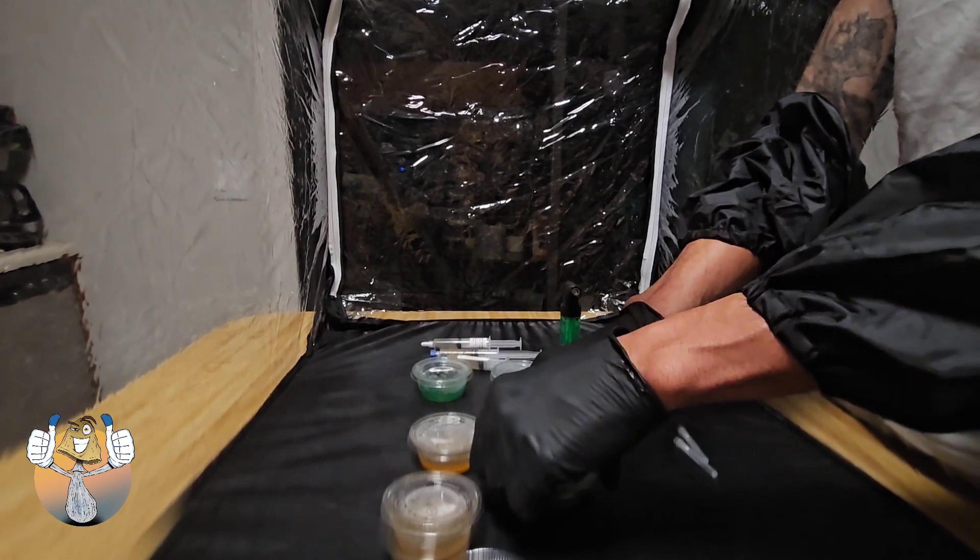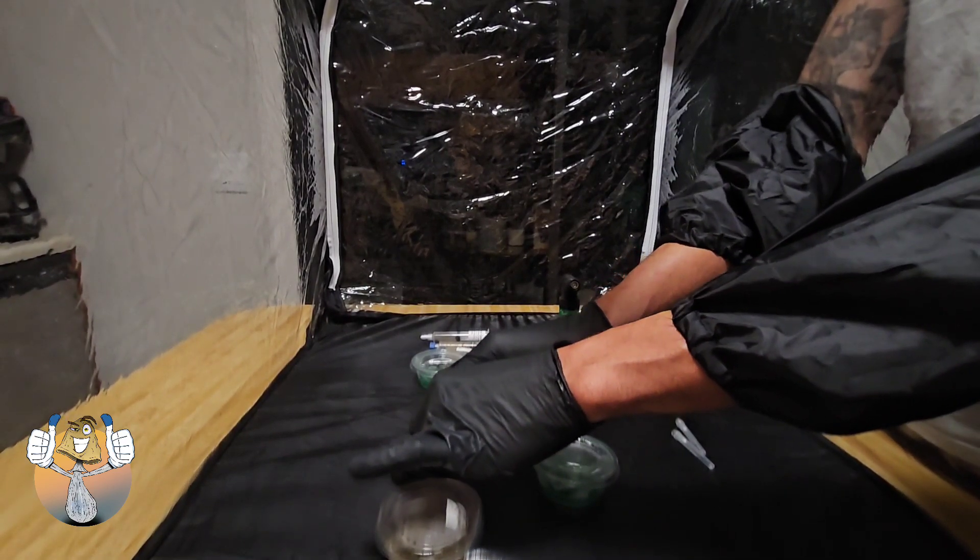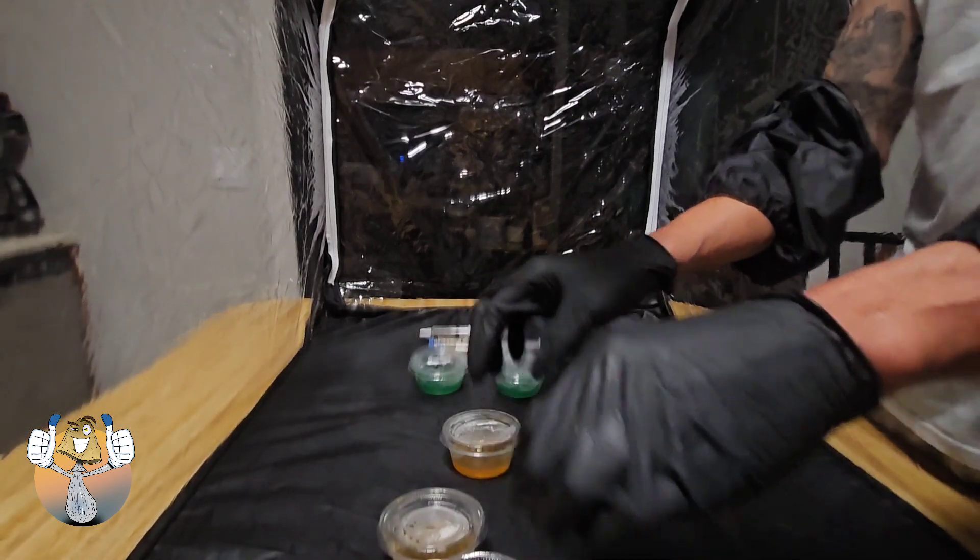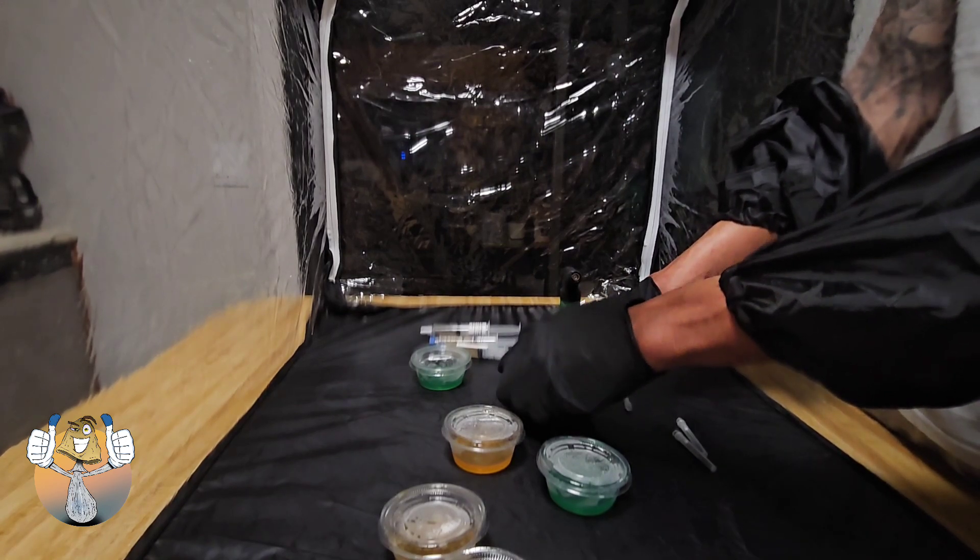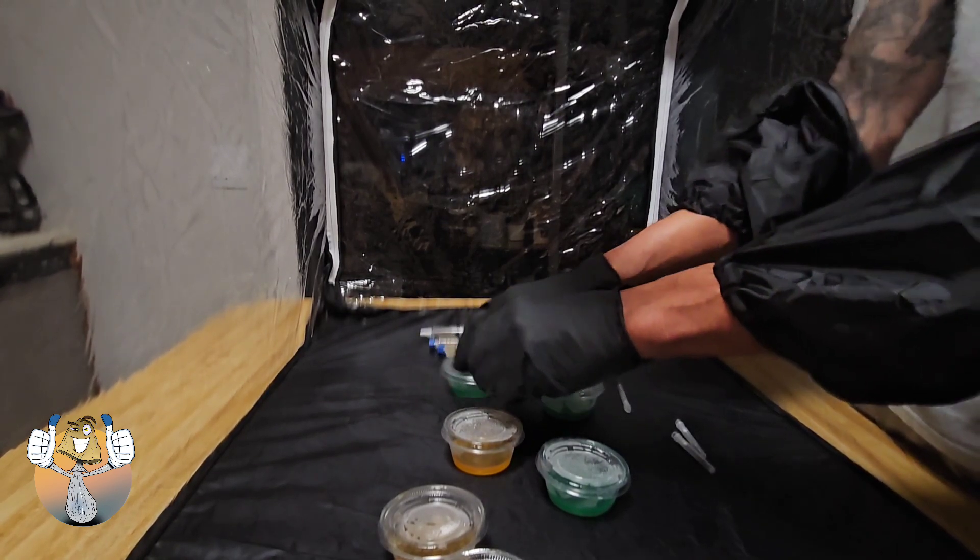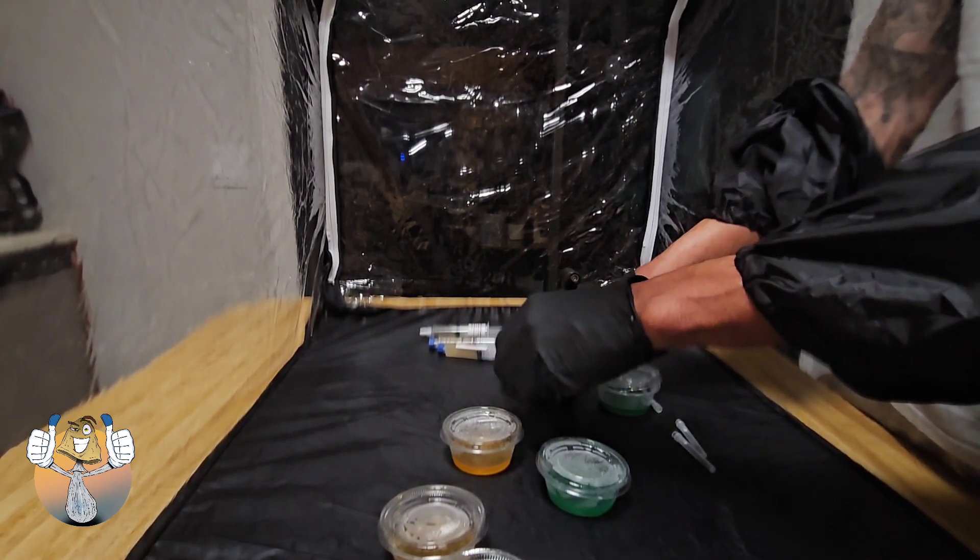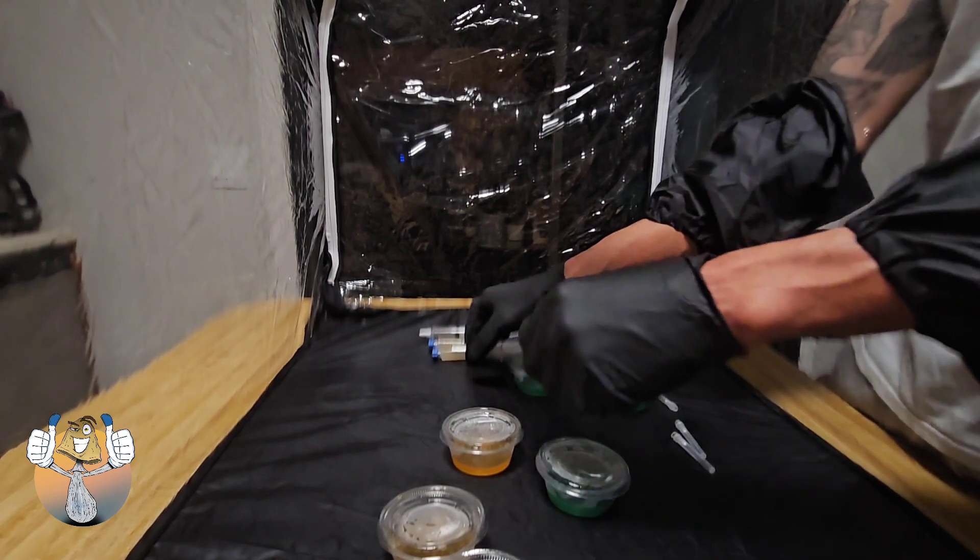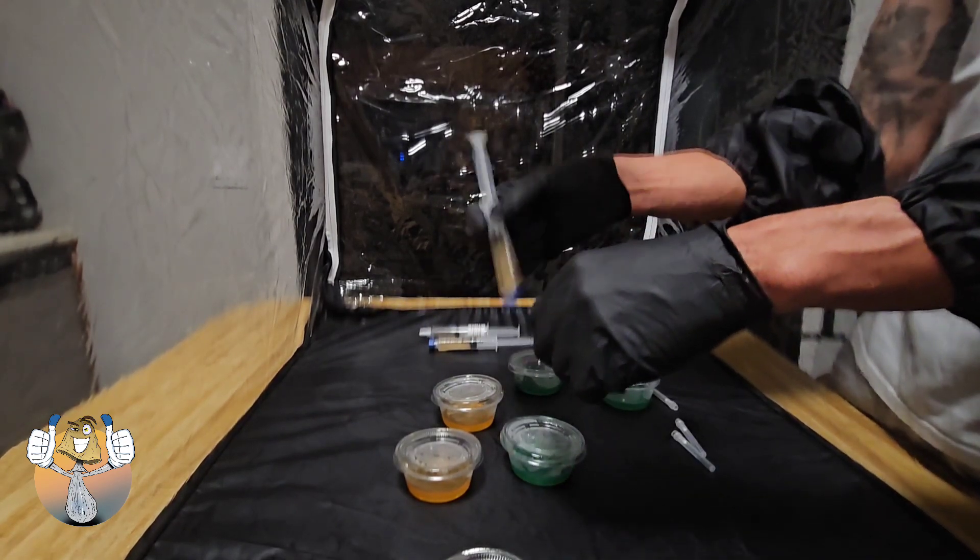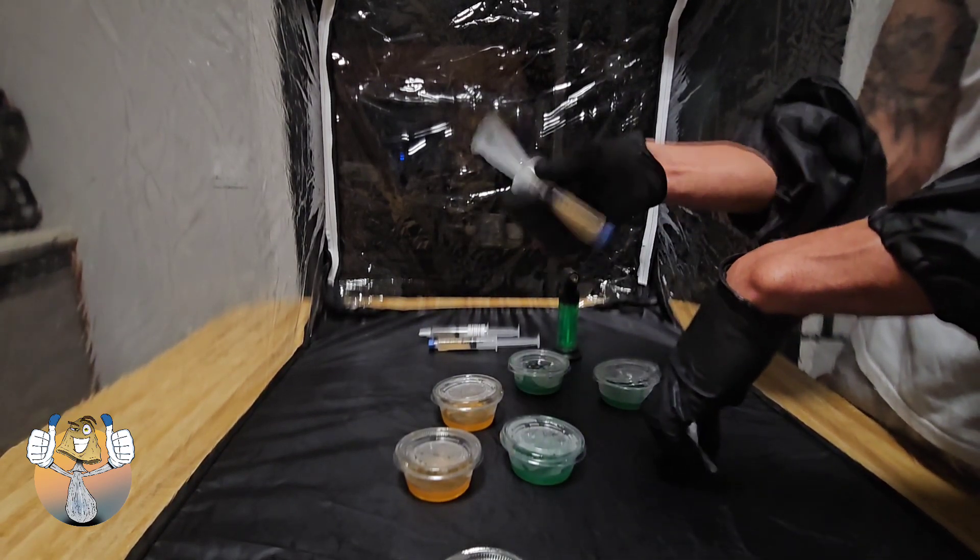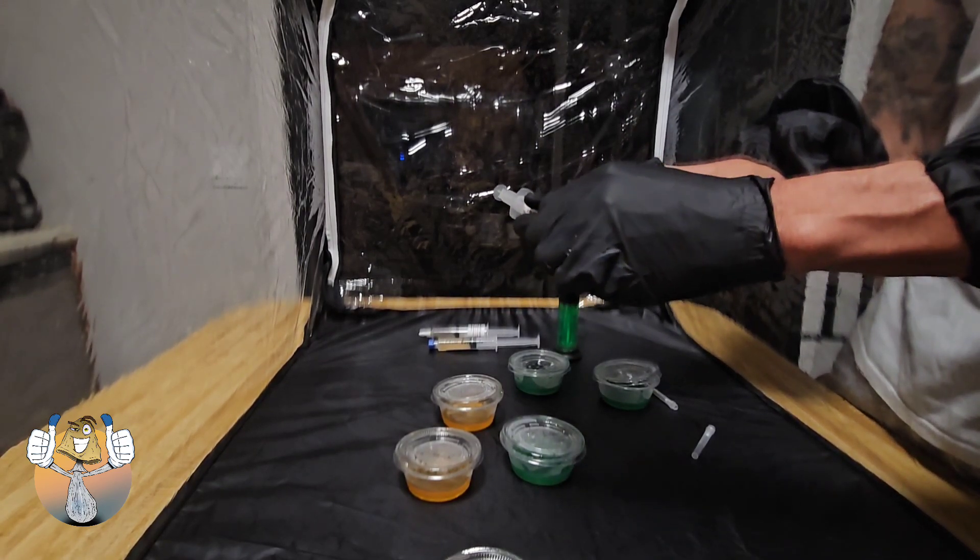All right, so right here I'm just opening up the lids a little bit, popping the lid, just so that way when we are ready to inoculate we can just pop the lid over real quick, squirt our solution, close the lid, set it to the side and move on. Remember, set yourself up for success. The longer you have the lid open, the more contaminations that agar plate is susceptible to. So move swift, move with intention.